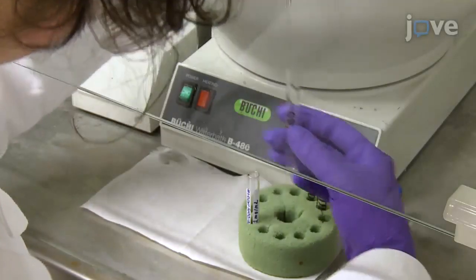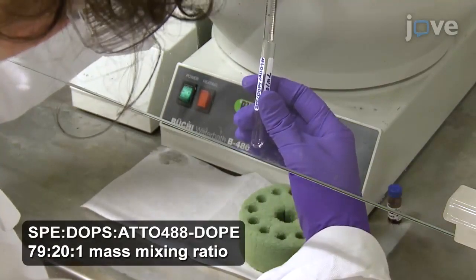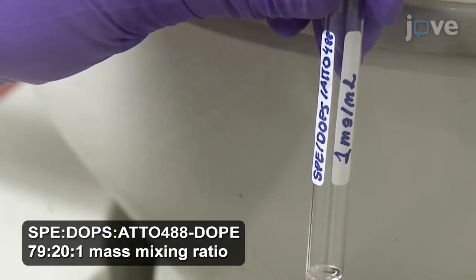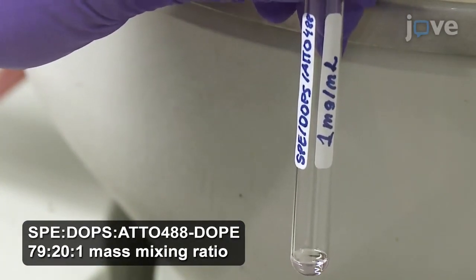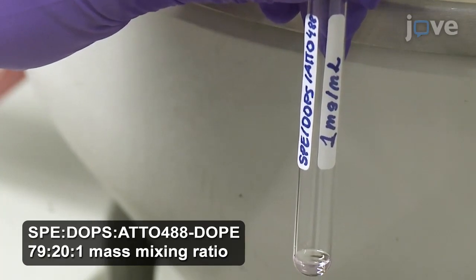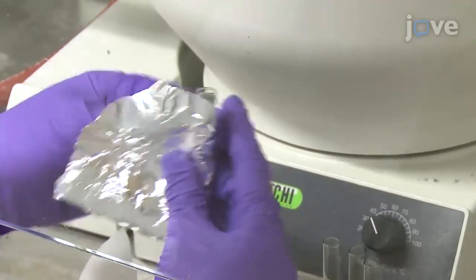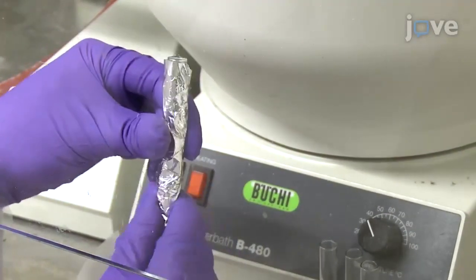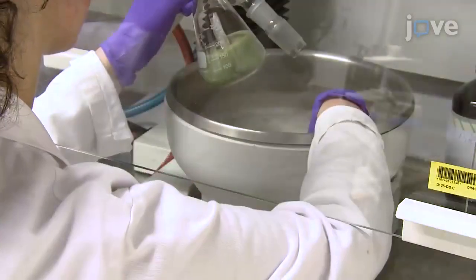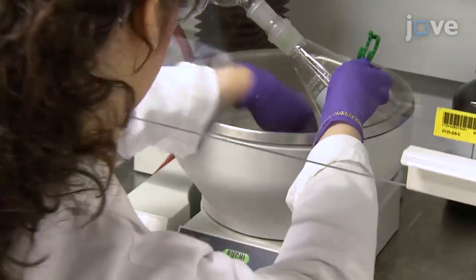To begin this procedure, prepare a solution of lipids in chloroform. The final concentration of lipids in chloroform is 1 mg per milliliter, and the final mass is 0.6 milligrams. Wrap the glass vial containing the lipid mixture with metal foil to protect the contents from ambient light. Place the metal foil-wrapped sample vial inside a glass beaker.